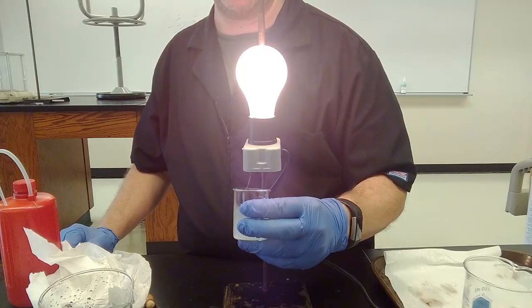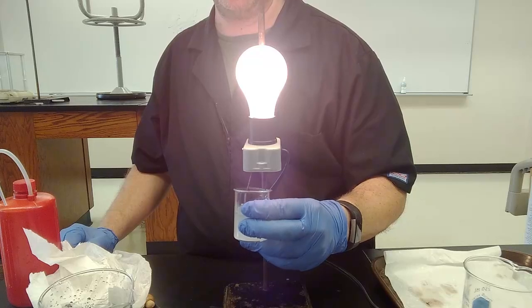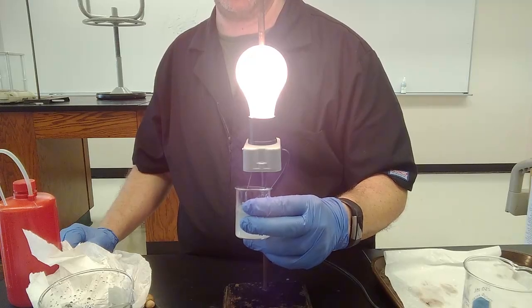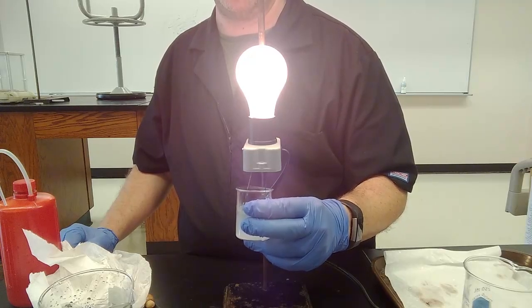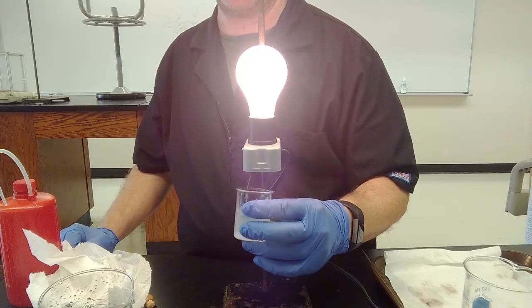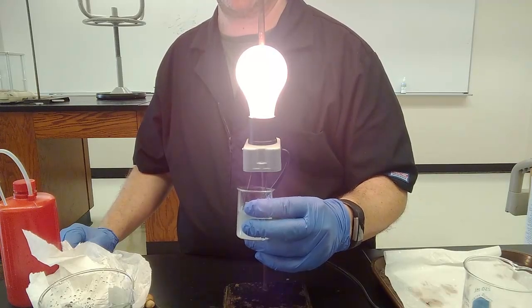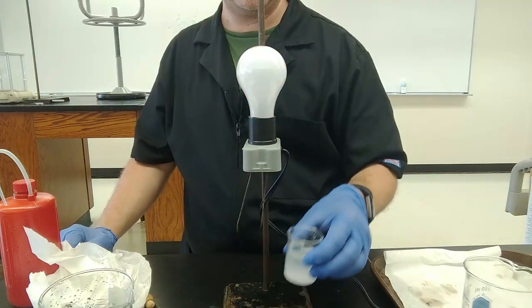Sugar dissolves in water great because it has OHs in it, just like water, HOH. Like dissolves like. So water will dissolve sugar wonderfully. Doesn't mean that it makes the sugar ionize. Calcium hydroxide, on the other hand, is an ionic compound, not to give too much away, and it's clearly enough of it dissolved in water to get us some light today.